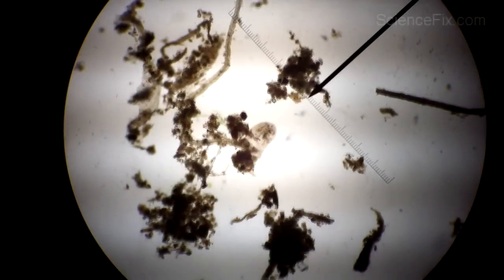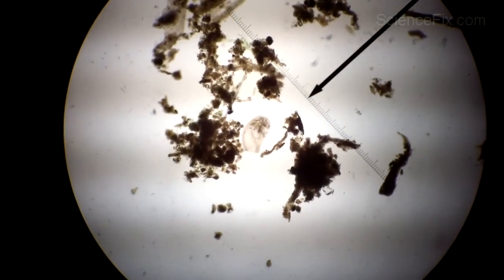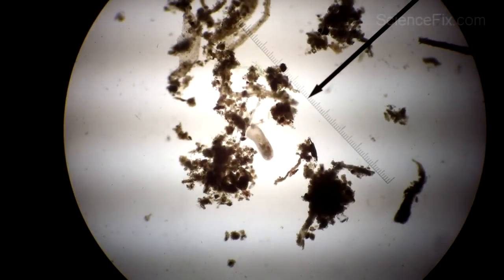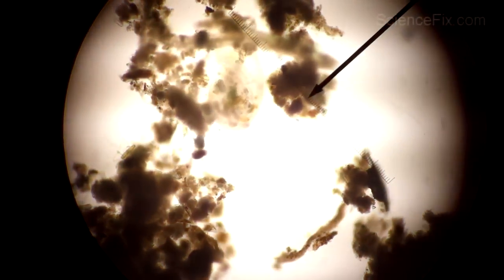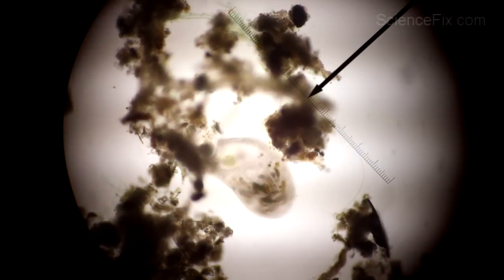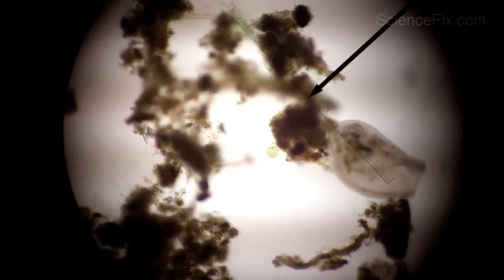One of the fun things about doing an activity like this is that you can't possibly know all these organisms' names. Like this one — I have no idea what it is. You can have your students find things out: have them get on their smartphones and computers and try to figure out what the names of these organisms are. Have them become the scientists.